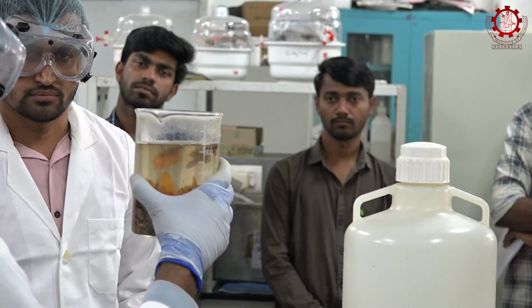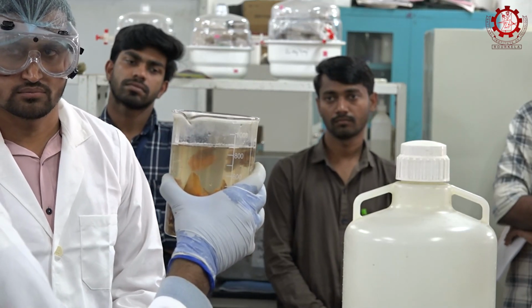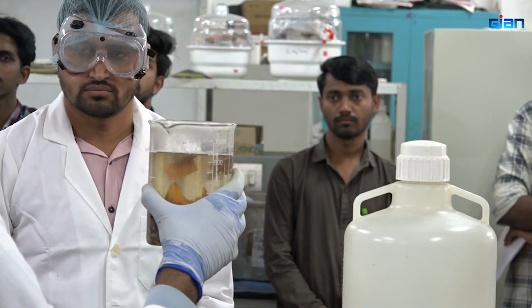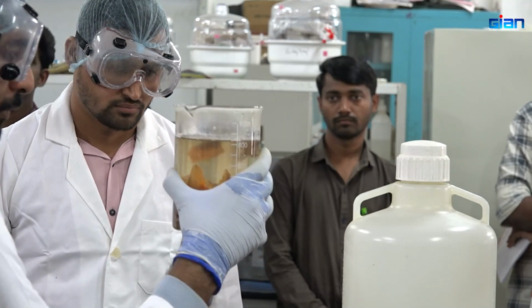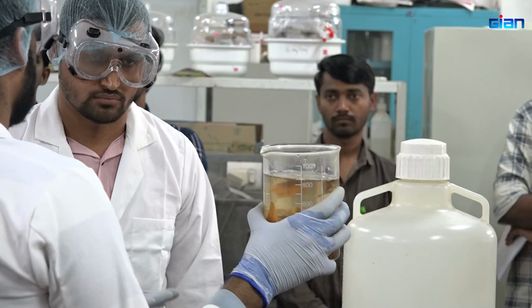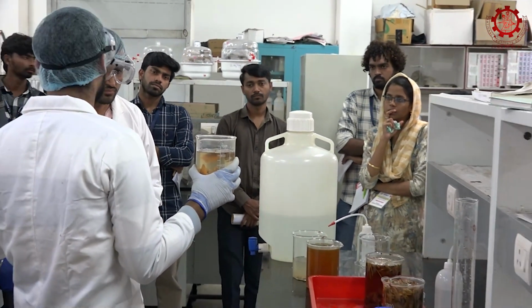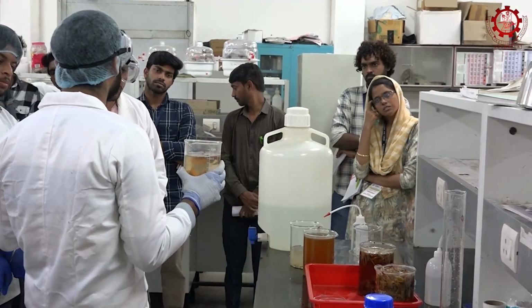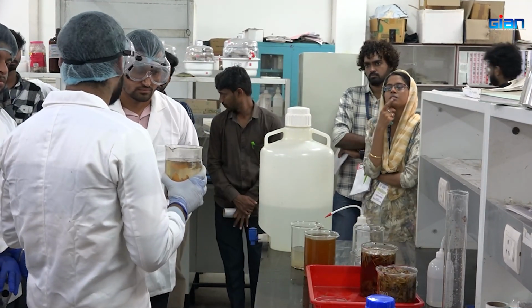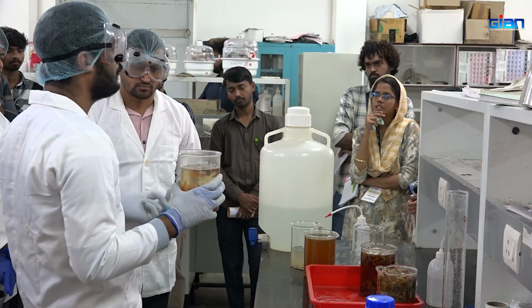Okay, so that's why we have taken almost 0.5 normal. If you are taking 0.2 normal, the rate of dissolution will be lesser. Tomorrow we will be separating the fraction, keeping it in a Petri plate and drying it. We will be getting the protein fraction and we will be checking for its purity, because it may contain other impurities. It won't be a 100% pure protein fraction. So that can also be done.